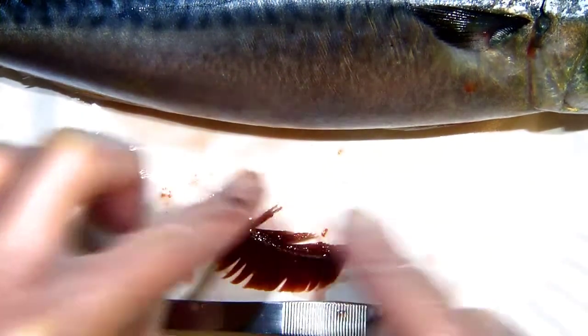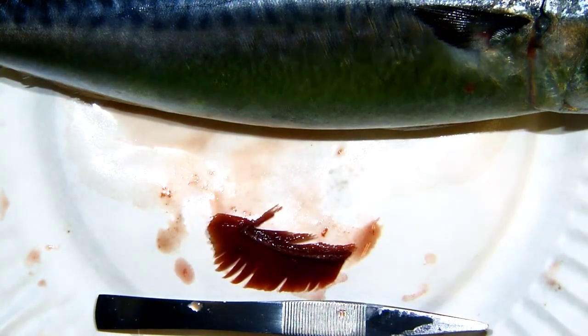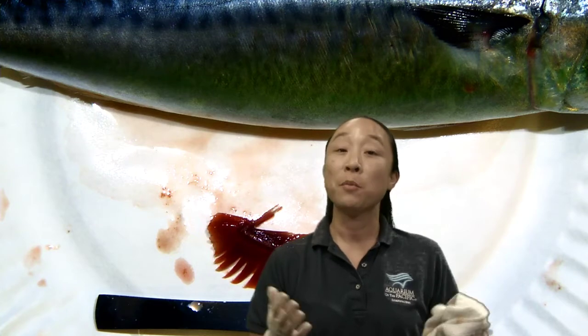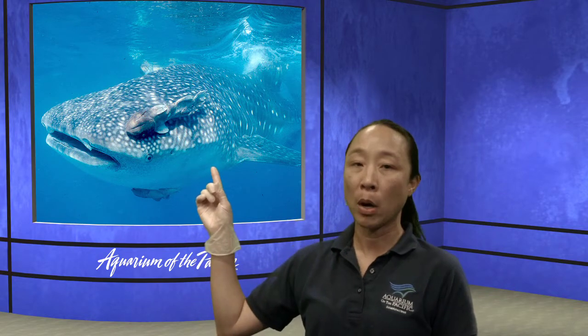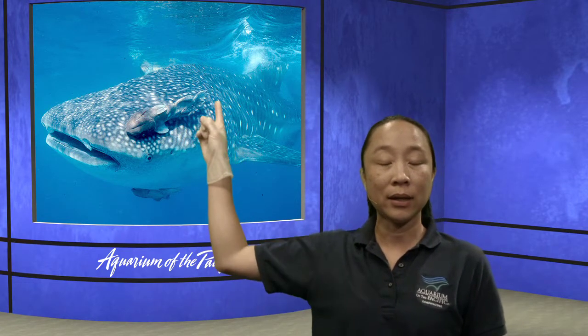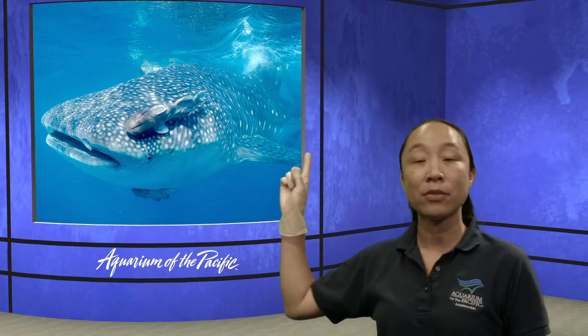The rakers can also act almost like a cage for animals that like to eat small animals filtered out of water. Some animals use their gill rakers to help them capture food. Has anybody heard of a whale shark or a basking shark? Whale sharks and basking sharks are actually fish — they have a backbone and gills. They actually open their mouth, water goes in and out of the gills, and those gill rakers rake out plankton inside that water. They capture it with their gill rakers, close their mouth, and swallow. So gill rakers actually help them catch food — sharks that don't use teeth for feeding.